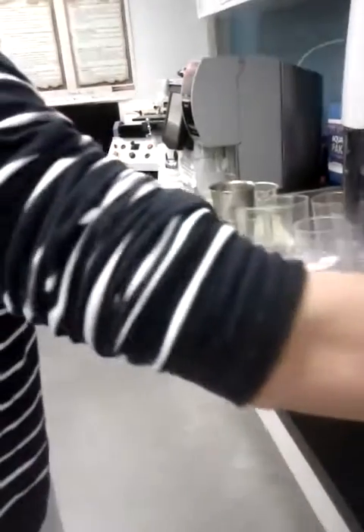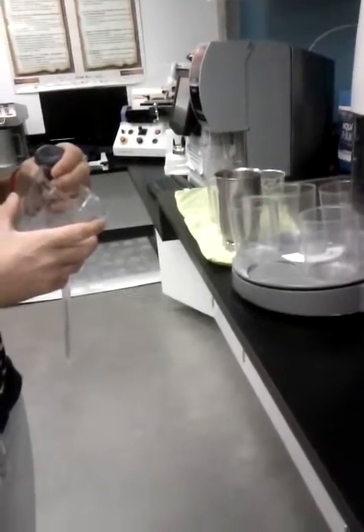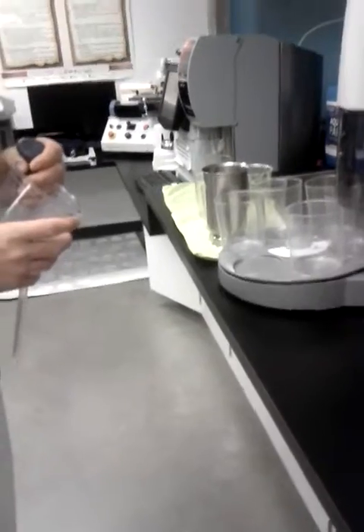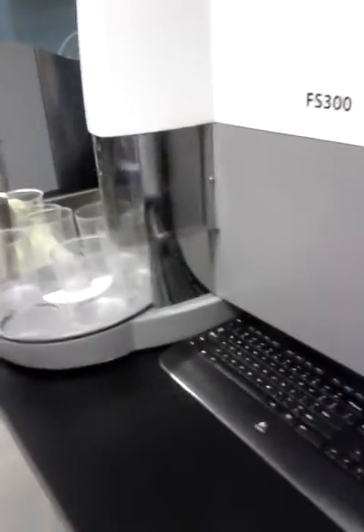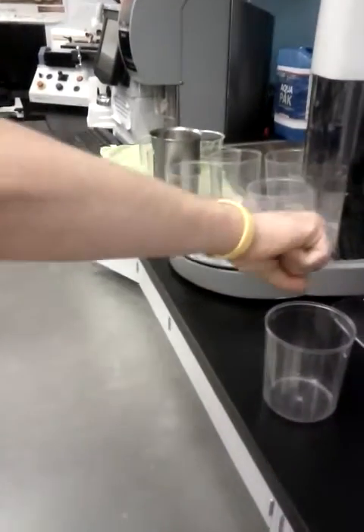So 0.5 grams, how many grams of sample will you have in 23 milliliters. So you're talking about the weight that you enter here. Okay. So you're talking about the volume, yeah? Yeah. So we know the weight, and you want me to measure the volume also. This is what you want to say? Yes. Volume of your samples? Yes. Okay. Because you put 0.5 grams, you dilute that.